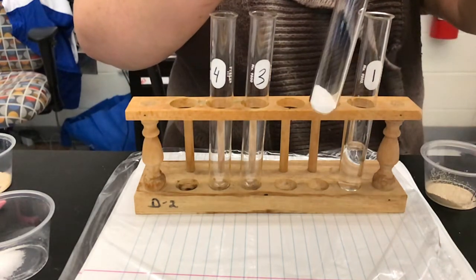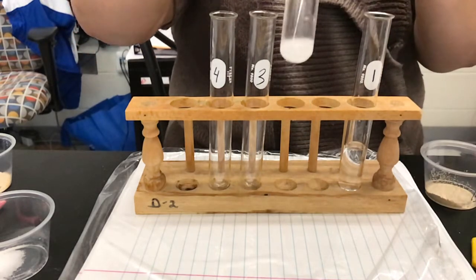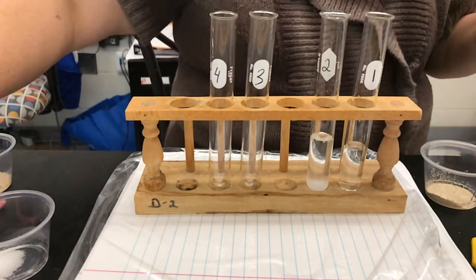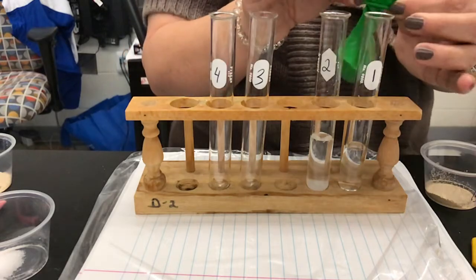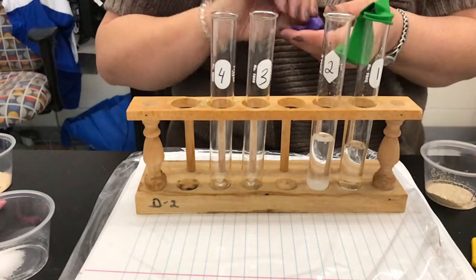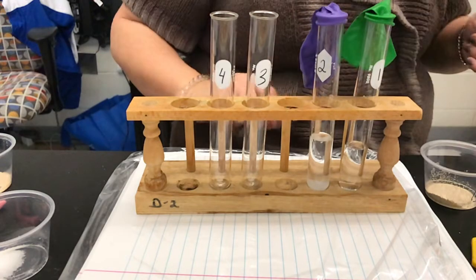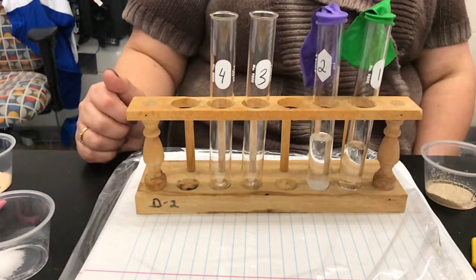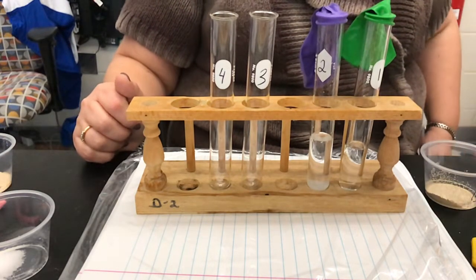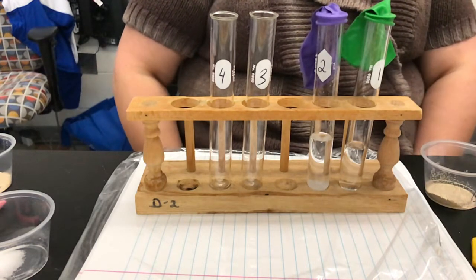And we're going to add our 10 ml of water. I wanted to put the sugar in first so it wasn't stuck on the sides — if I put the water in first, some of the sugar might stick to the wetness on the sides of the test tube. So that's why I put the sugar in first. So there's our balloon on our water, and then we're going to put our balloon on our shaken water and sugar. On your chart, test tube two: 10 ml water, two grams sugar.